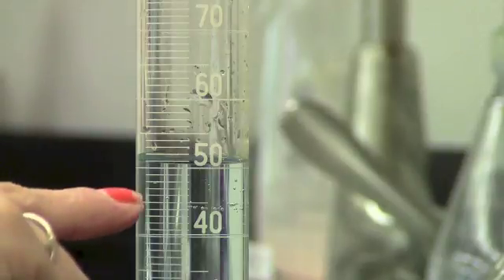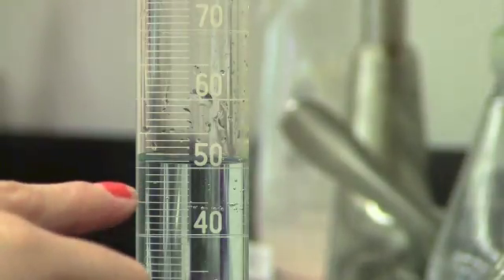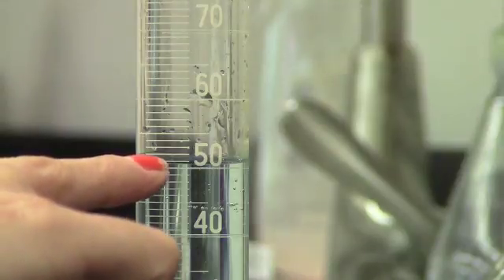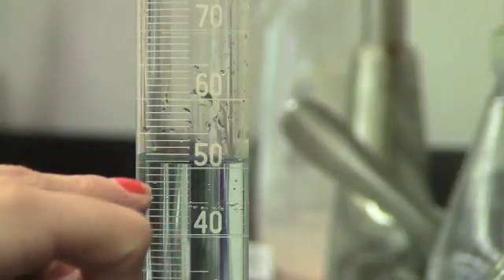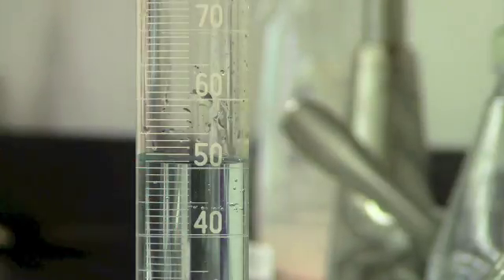And again, I'm going to figure out all the digits I know for sure. So I can see pretty clearly that this is exactly between 51 and 52 milliliters. So I'm going to record my volume here as 51.5 milliliters, the .5 being my estimated digit.